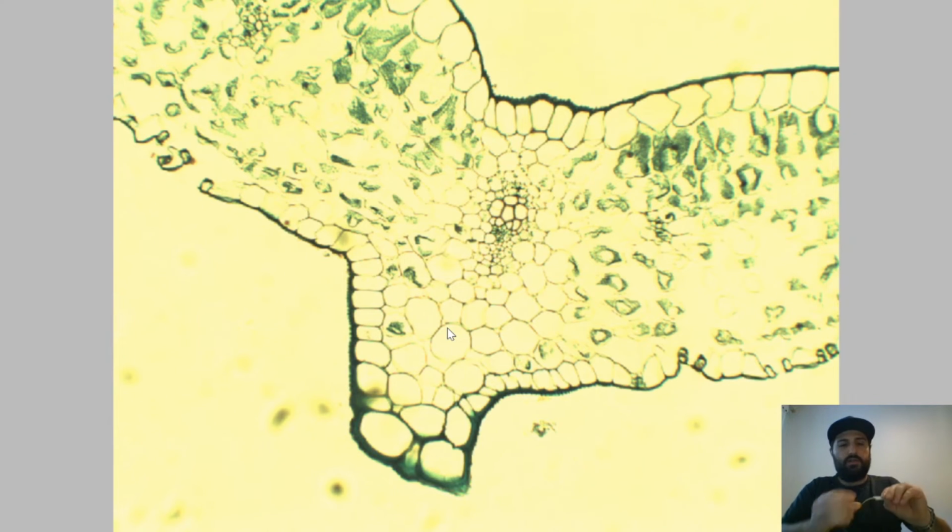Sorry, I should have done this earlier. Have that leaf stacked in here, and then you cut thin slices off into water, and then you're able to collect those and wet mount them onto a slide. So it's similar to the microtome, just the microtome is trying to achieve a much thinner slice and therefore give you the most clarity. But there's a little bit more involved in that.